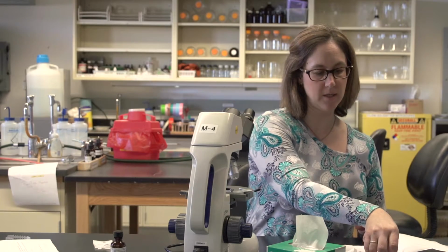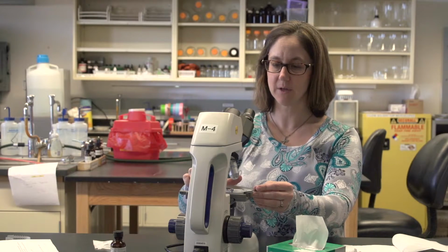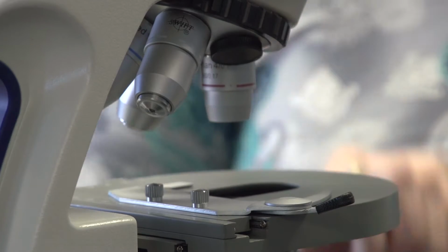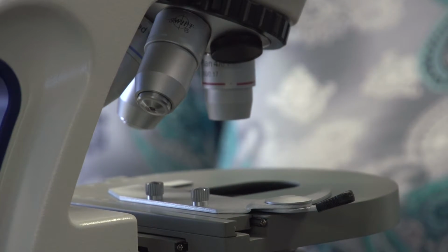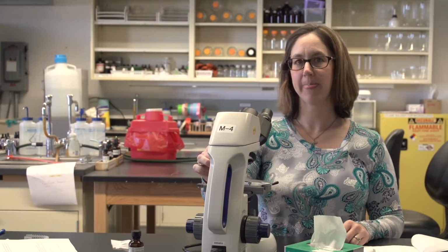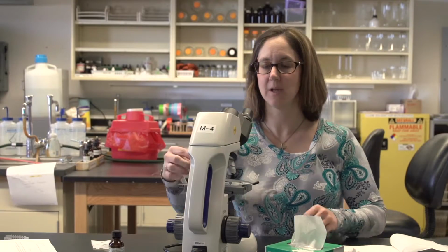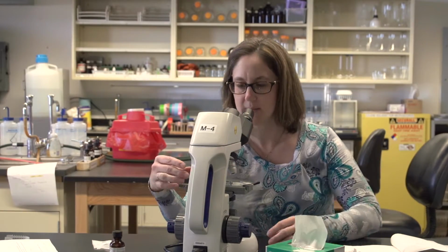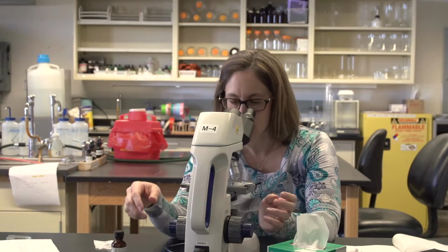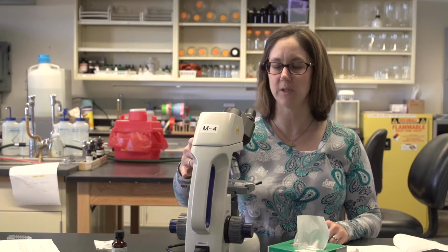You can then take your prokaryotic slide, put it back into the microscope, adjust back to the 4x objective, bring the stage all the way up, and begin refocusing on the organism. Once it's focused at 4x, you can turn to 10x, refocus with the fine focus, shift to 40x, again refocus. Make sure it's well in focus and right in the center of your field of view.